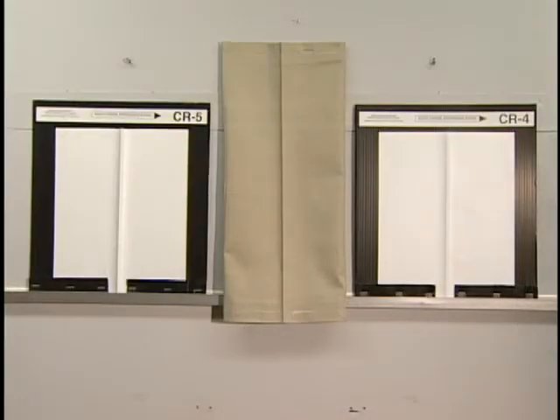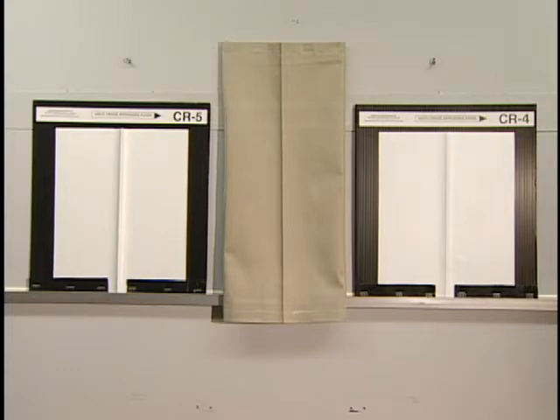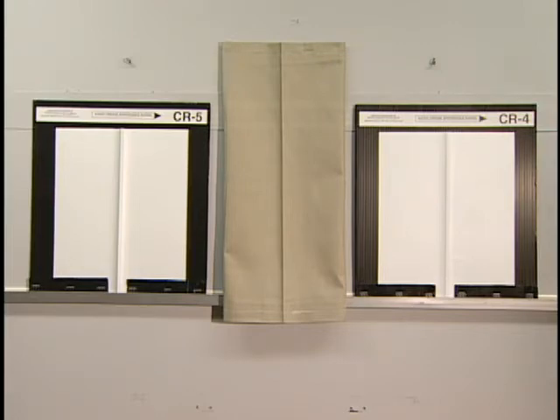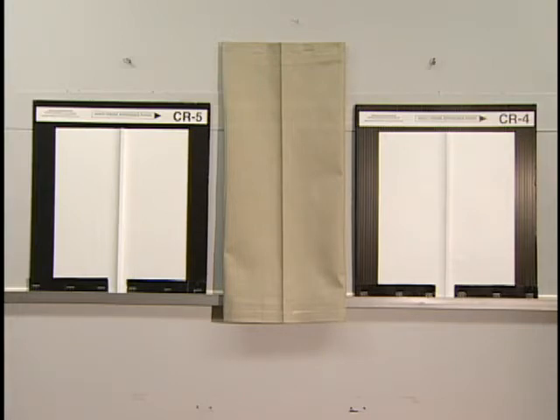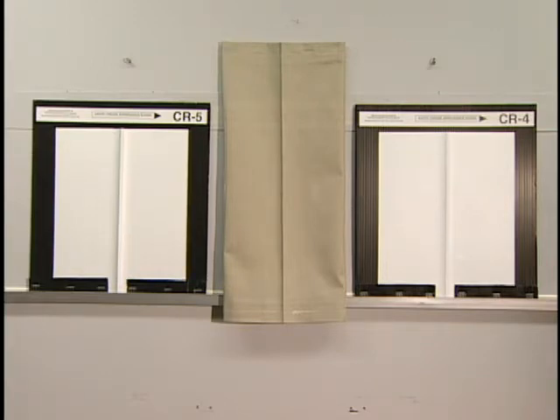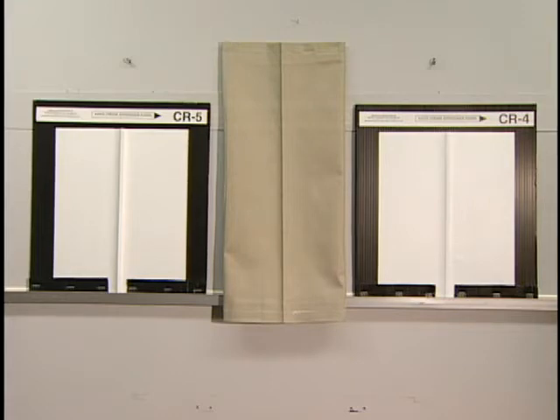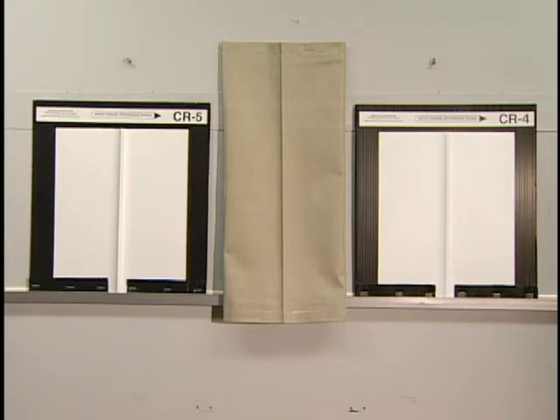The crease retention of a fabric or garment is the visual impression of an inserted crease that can be quantified by comparison with a set of reference standards. Creases in fabrics and garments can be rated using AATCC test methods. AATCC Test Method 143 is for apparel and other end products made of textiles. AATCC Test Method 88C, Retention of Creases in Fabrics After Repeated Home Laundering, is also used and primarily in the development of crease retention finishes at the mill. In this scenario, only pant legs are evaluated to save on the amount of fabric used.